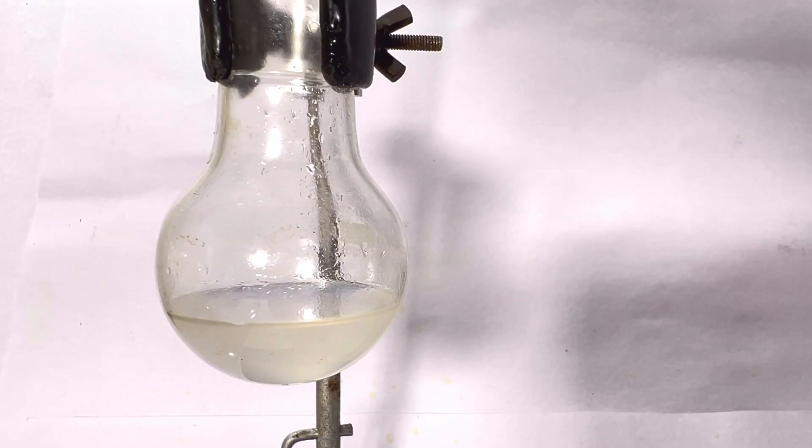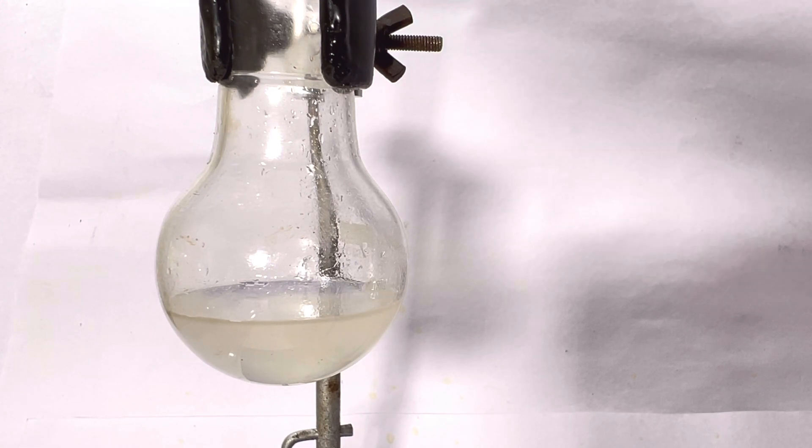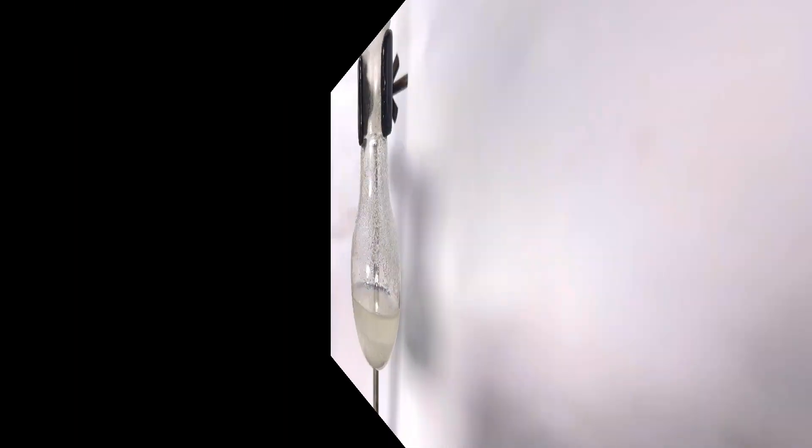The distillate was a little bit cloudy so I added some sodium sulfate anhydrous powder and this immediately cleared the solution.